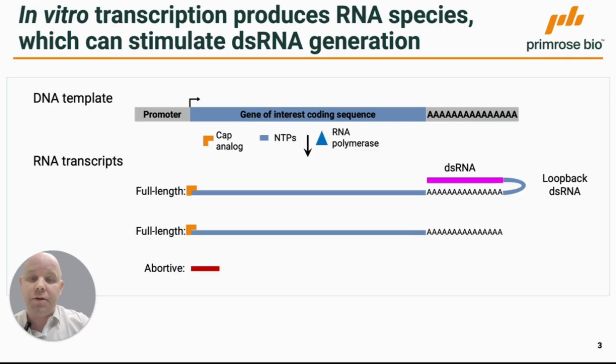There are many different mechanisms described in the literature, and one of the most common is predicted to be loopback double-strand RNA, where we have a 3' extension, and the RNA polymerase transcribes back on the intended full-length transcript, forming double-strand RNA. Another proposed mechanism is priming of the full-length transcript with an abortive transcript, stimulating transcription back on the full-length transcript, forming double-strand RNA.